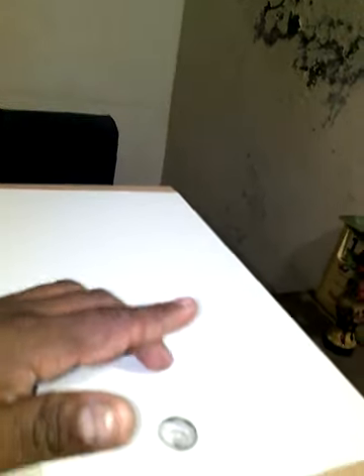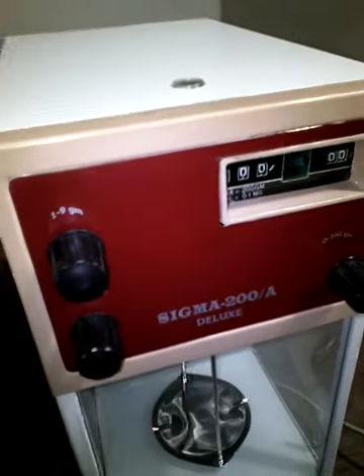Now place the cover plate and check the photo glass screen reading by using the operating knob. The reading present at the photo glass screen is now close to zero. This reading can finally be adjusted with the help of the fine zero adjustment screw present at the right side. By moving the fine adjustment screw, you can adjust the zero reading present at the photo glass screen. After being assured that the zero reading is present parallel to the black mark level, you can make sure that the reading is set correctly.